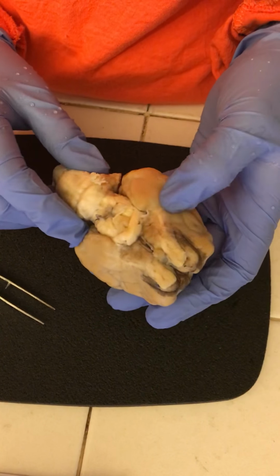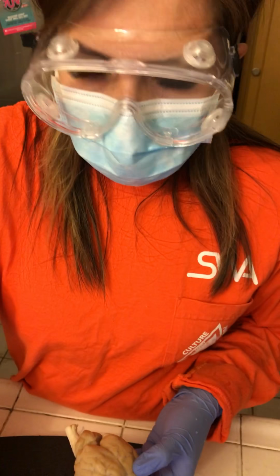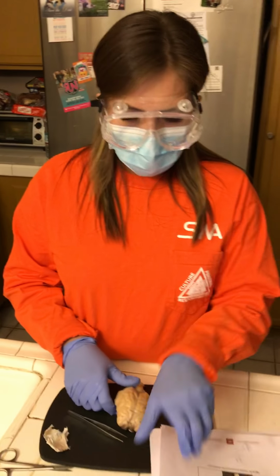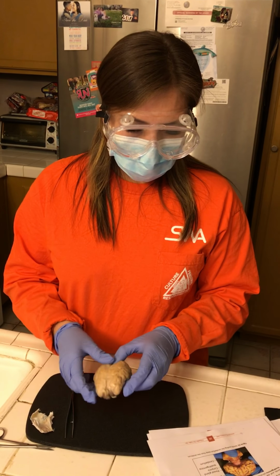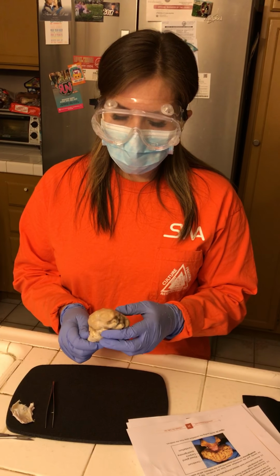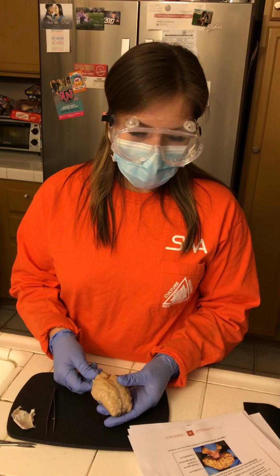Other than that, actually, there's one thing I'm not too sure. I forgot where the sulcus is at. I will have to take a point for that because I don't remember where that one's at. So I will go ahead and get started on a few other parts, but basically that's what I did want to discuss for this part of my lab, just point out those parts of the brain. The next things that I'm going to do are a little bit of dissection as far as opening it up and taking a closer look at it.